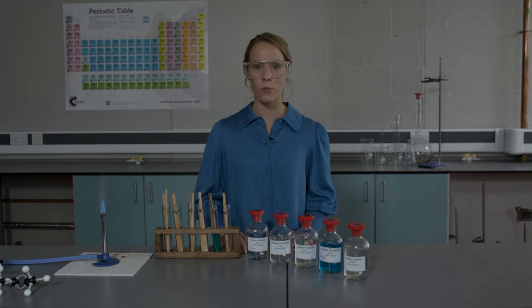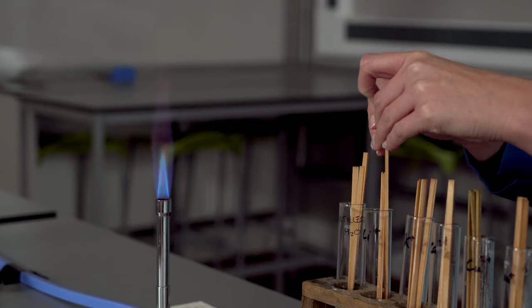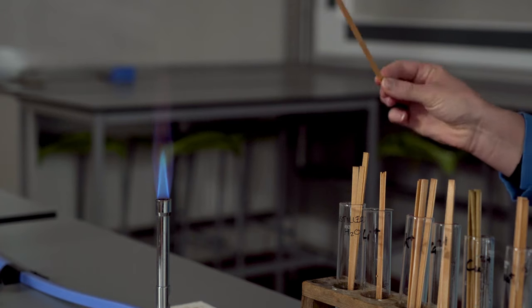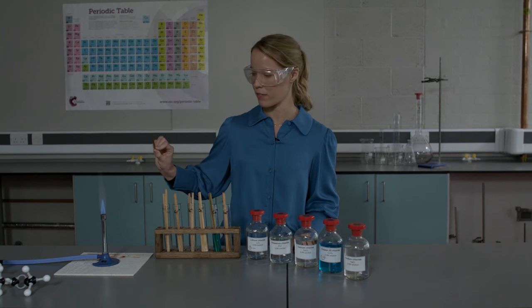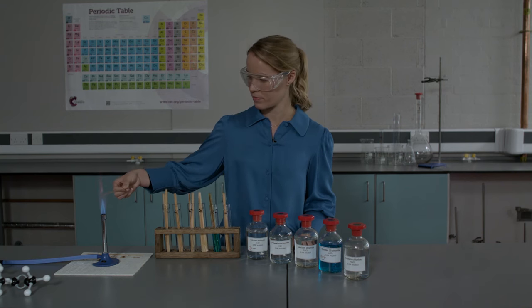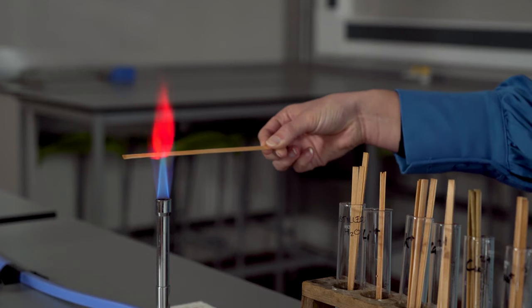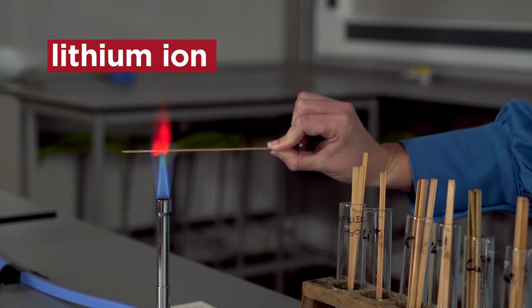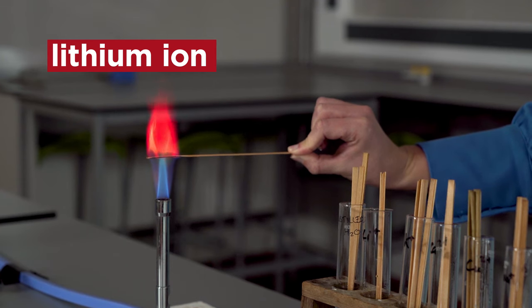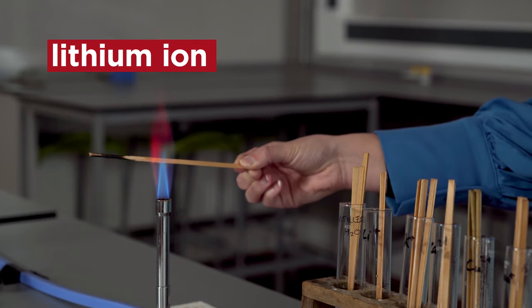So let's start the flame tests. I'm going to start with lithium. I'm going to hold the splint gently over the Bunsen burner flame and observe the color. Can you see the red flame color? We call this crimson, and you'll see why in a minute.